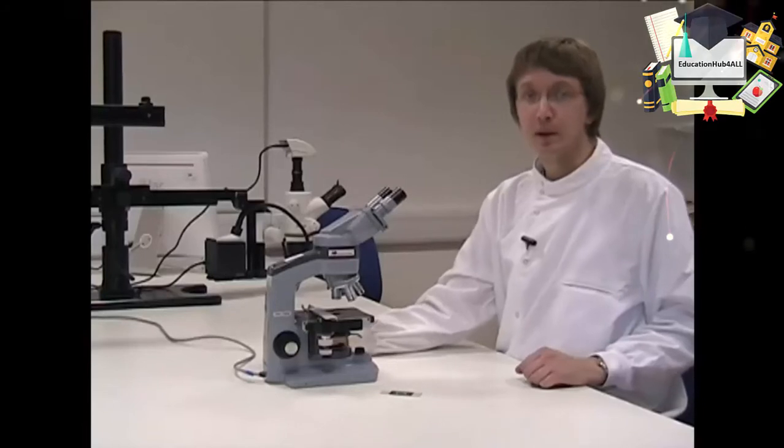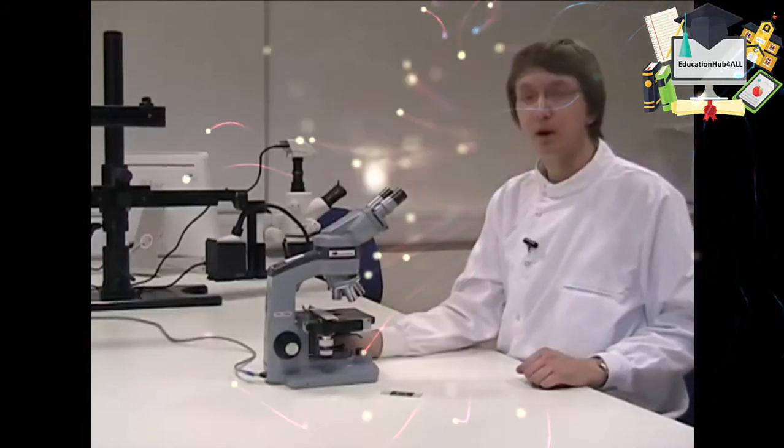Hi, I'm Chris and today I'm going to be talking about how to set up a basic compound light microscope like this one.